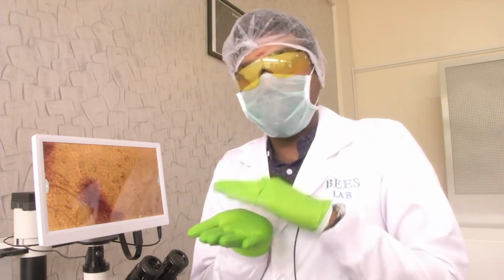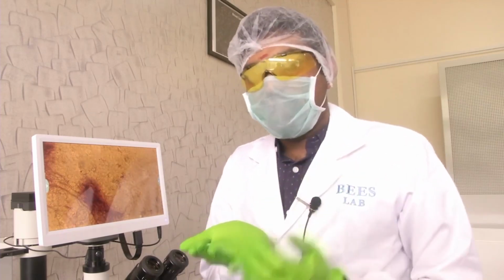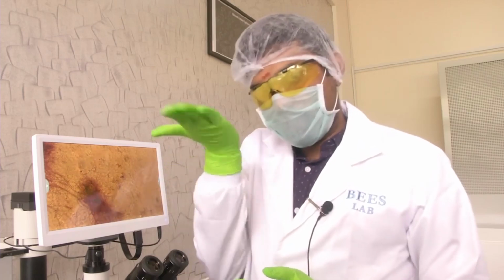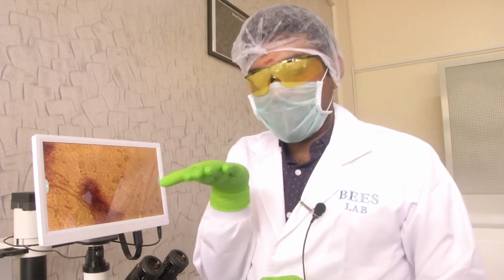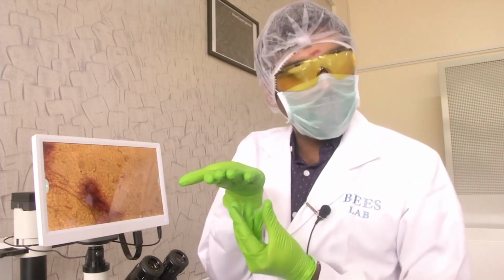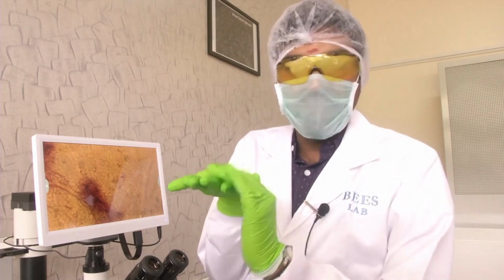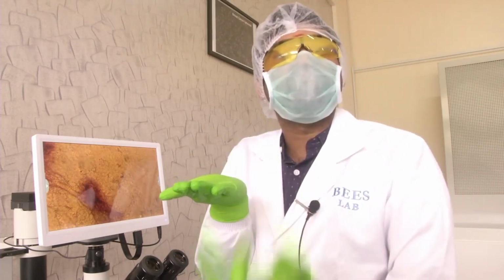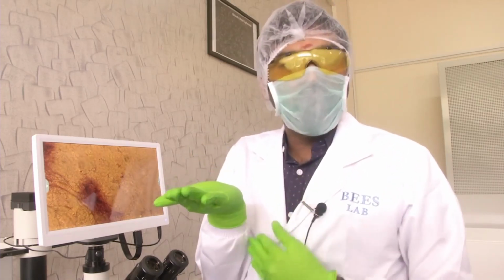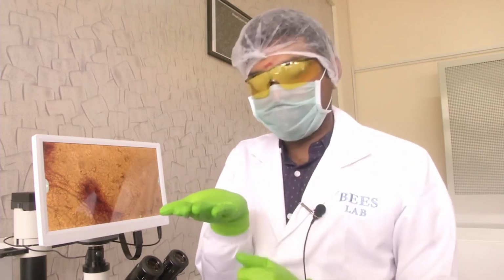Because at the end of the day we are talking about optics. Now, what is so special in the inverted microscope? In the inverted microscope, the cells will be like this. Again, it will be at the bottom. There might be solutions at the top, but then your objective will be at the bottom. So, your objective will always find your cells as the first layer that it has to image. This way, you will be able to focus the cells much more easily and with surety.